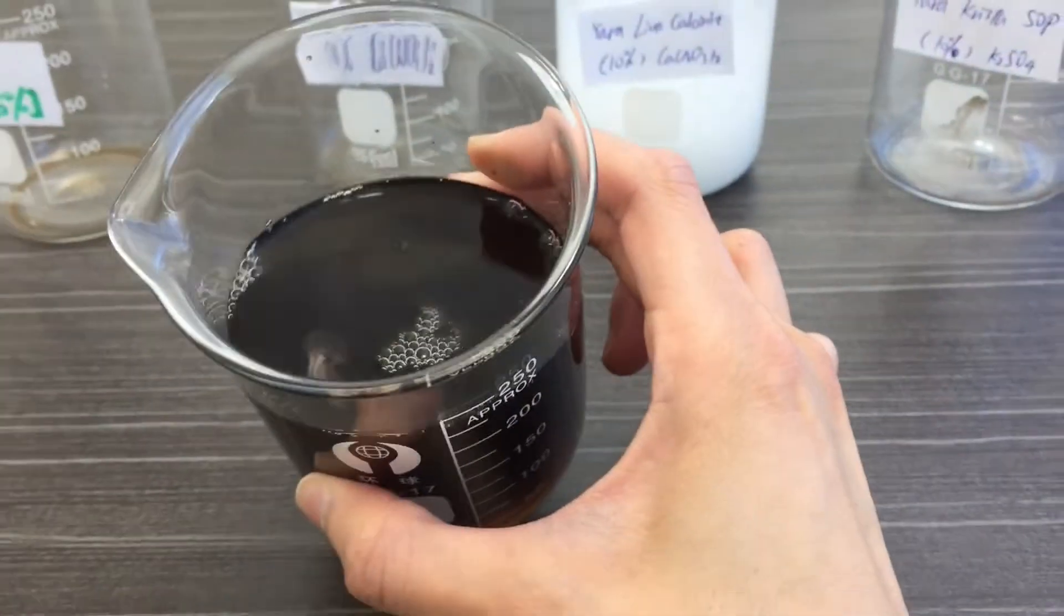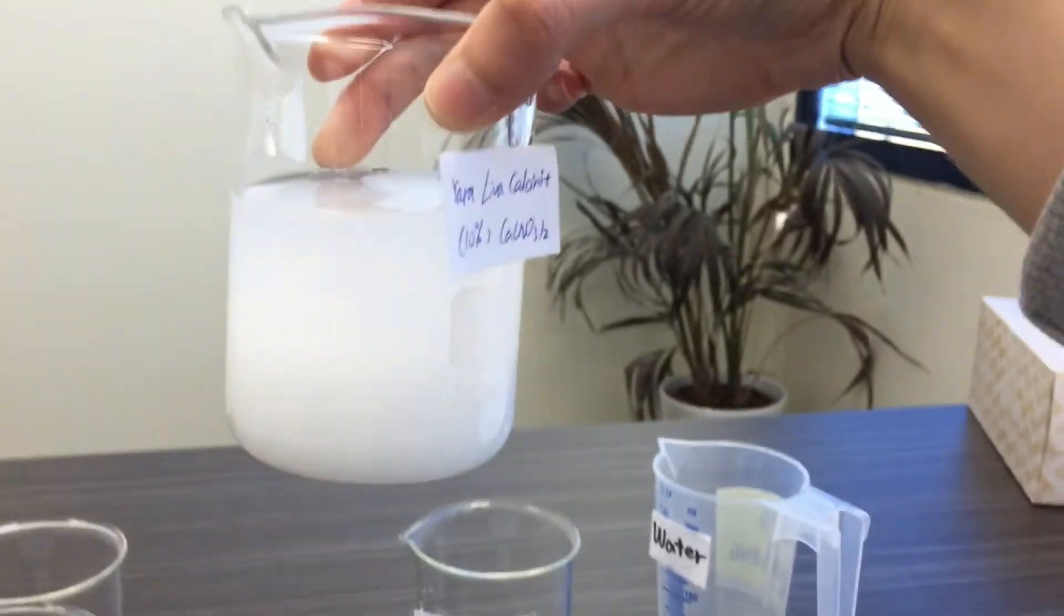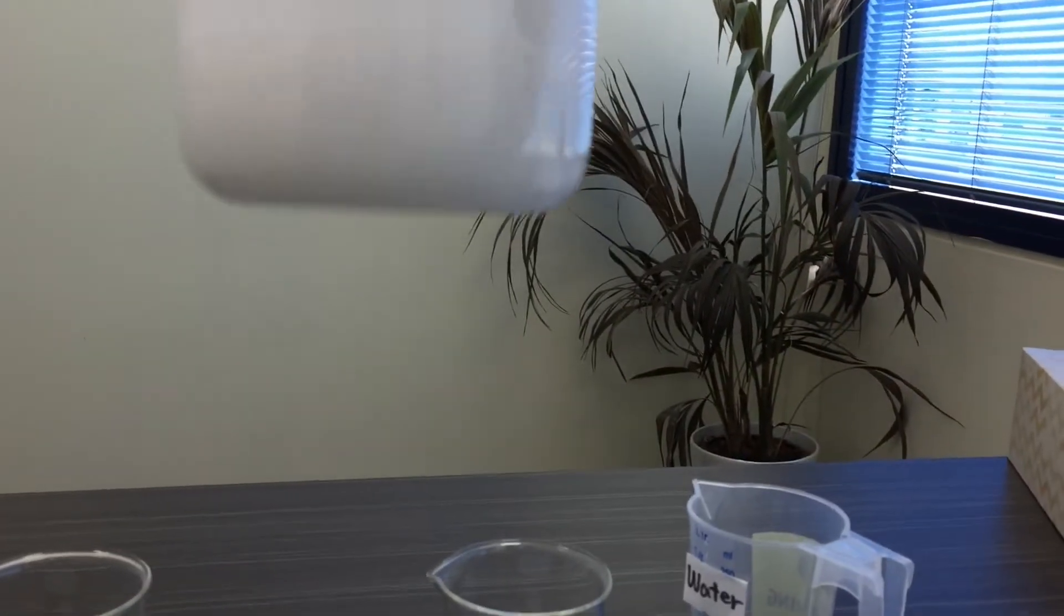There are no precipitates at all, and this is still a clear solution, whereas in this one the precipitation is very clear.